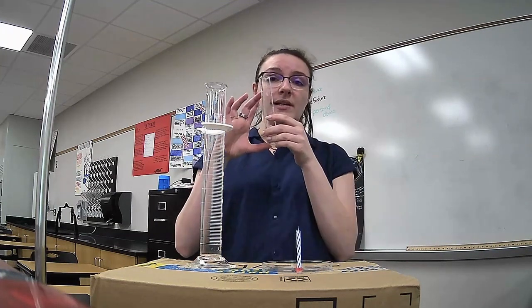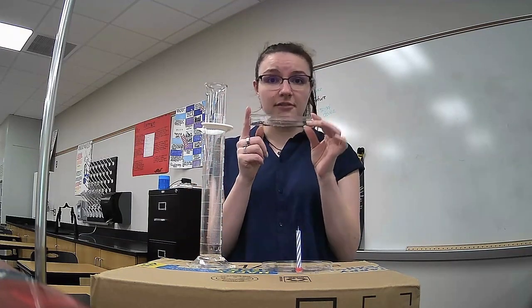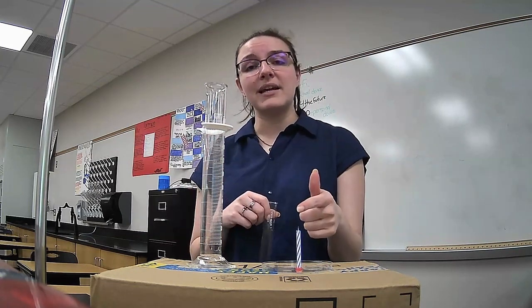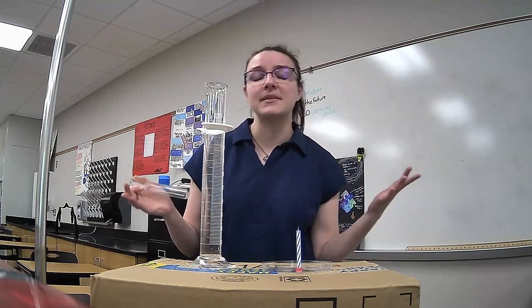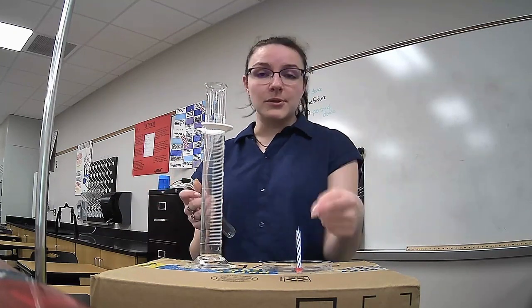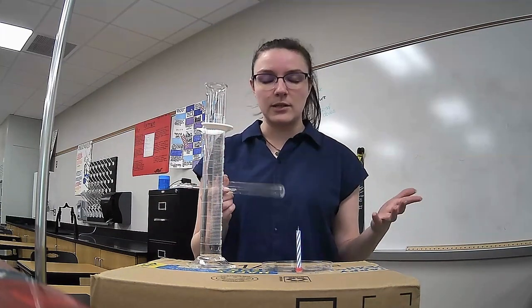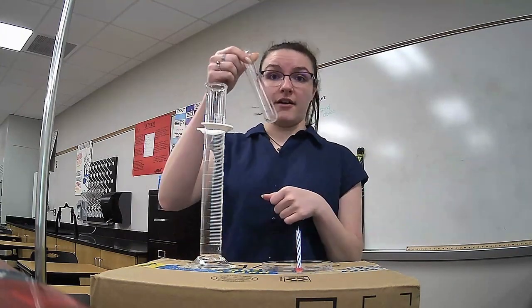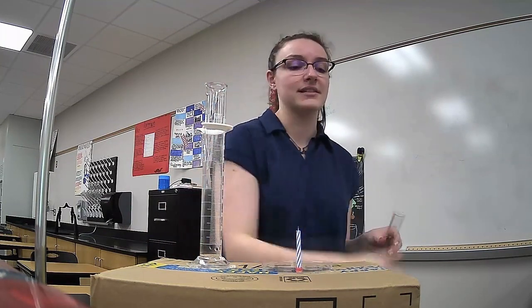My goal here is to see, right now there's air in this test tube. I don't know the volume yet, but this is currently full of air. Using my candle, I'm going to burn up the oxygen. Oxygen is the only gas in the atmosphere, in the air, that is combustible. It is the only gas that can be burned up. So using this candle, I'm going to burn up the air in this tube and replace it with water, replace it with something else, and see how much of the air burned up. So before I can do any of that, I need to figure out the volume of this test tube.